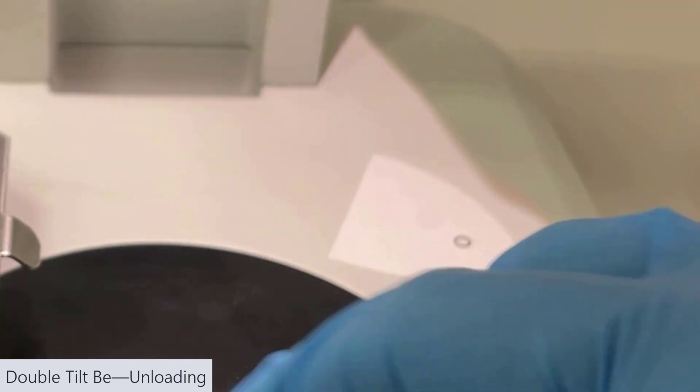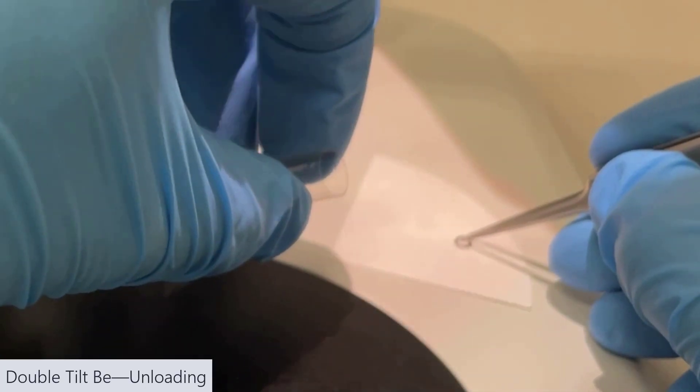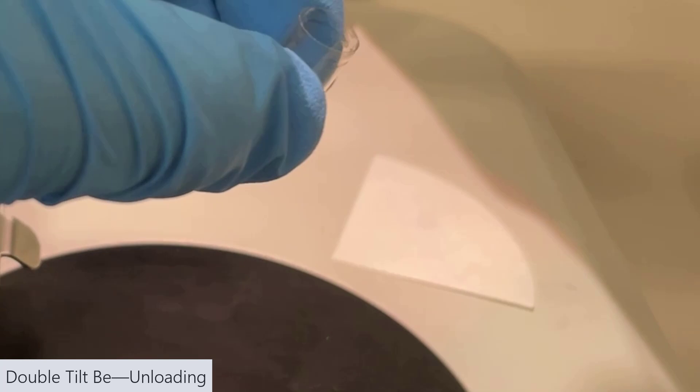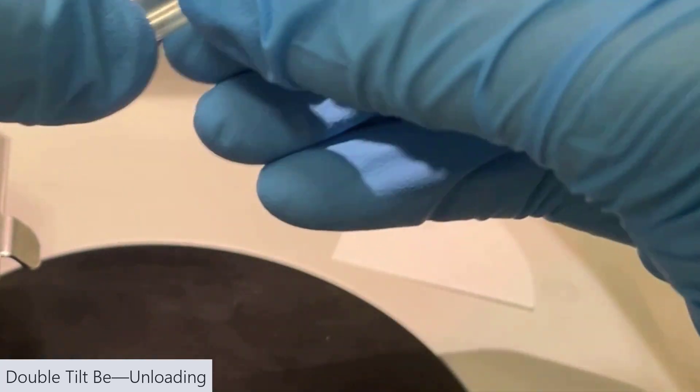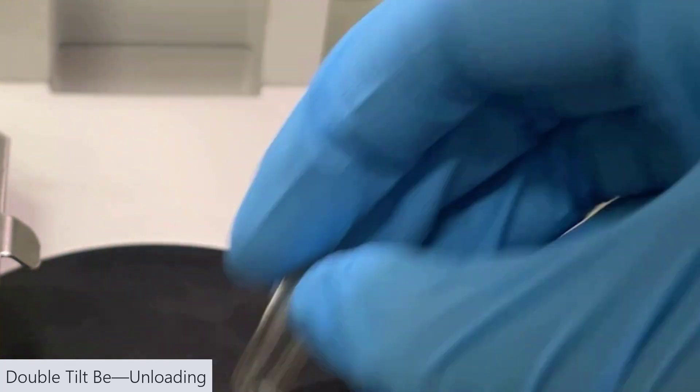If your lab doesn't do this, obviously, you wouldn't do that. And that's it. So now you know how to load and unload samples on three different types of JEOL TEM holders.